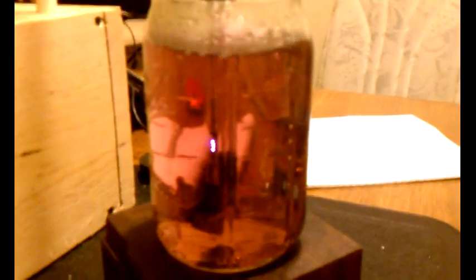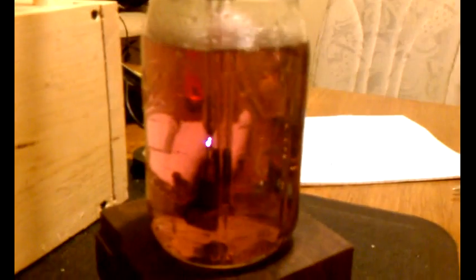This is after I redid my electrode setup. Kind of hard to see inside the jar, but there it is. And what I've got here is 750 milliliters of pure distilled water, 10 milliliters of H2O2. And I've got a bubbler air hose going in there instead of using my magnetic stir, because a good friend told me that the magnetics could mess it up.